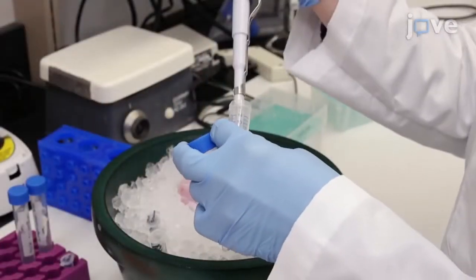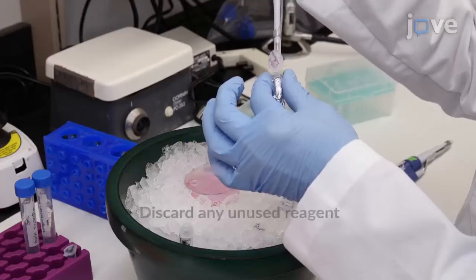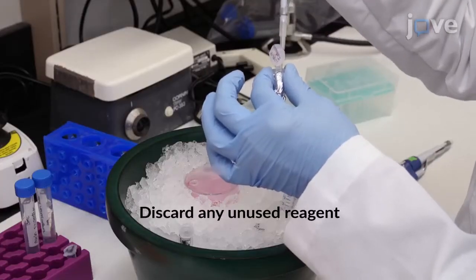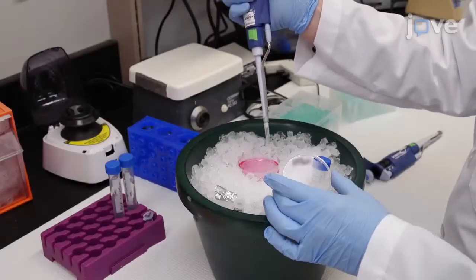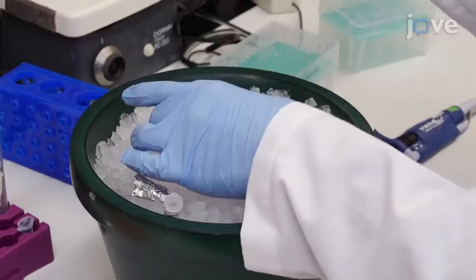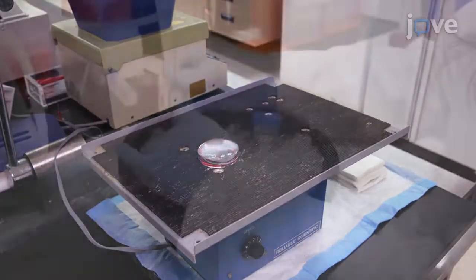Make a fresh stock of 10 millimolar iodoacetamide just prior to use. After cells reach 50 to 60% confluency, add 0.1 millimolar final concentration iodoacetamide directly to the cell culture media. Gently rock the dish at room temperature for 2 minutes.